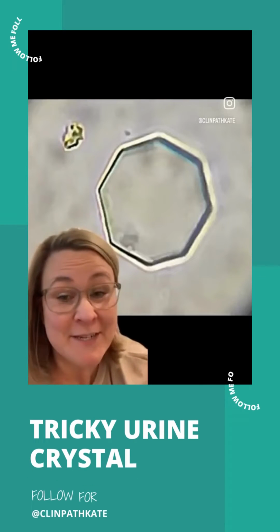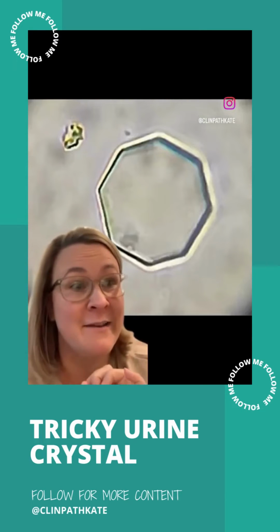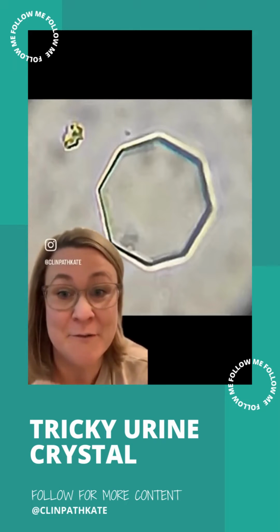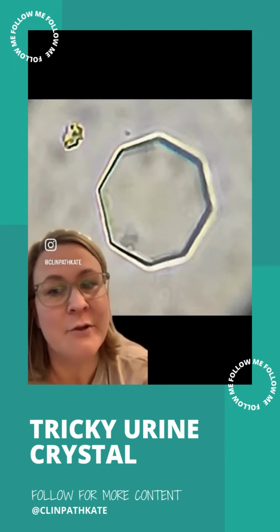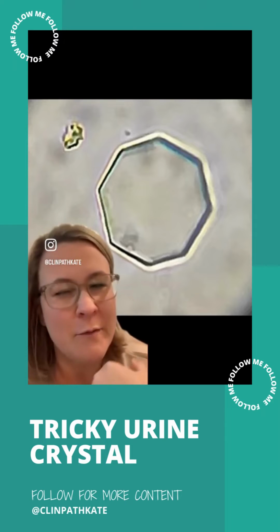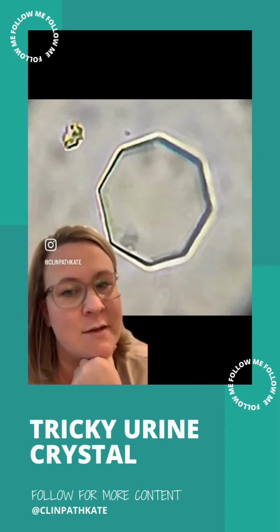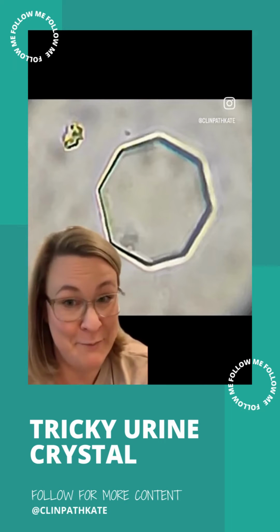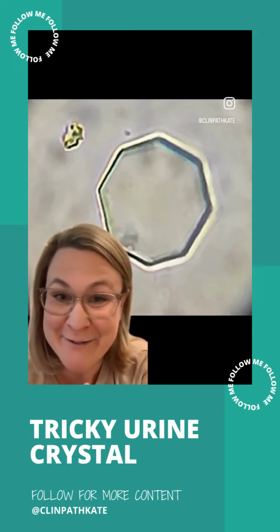Here's a quick tip for today on a very common and very frustrating situation. Here is a urine crystal from a dog. What do you think that urine crystal is? Think to yourself, what would I call this if I was doing the UA on this dog? If you thought cystine, you would not be alone, but you would not be right. But that's okay, because that's why we're doing this quick tip.